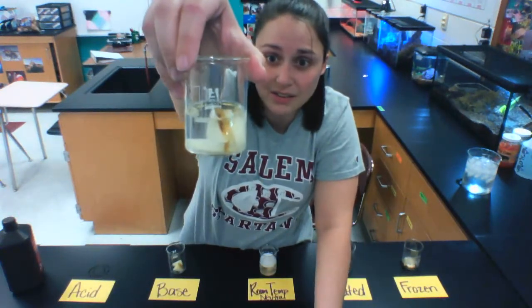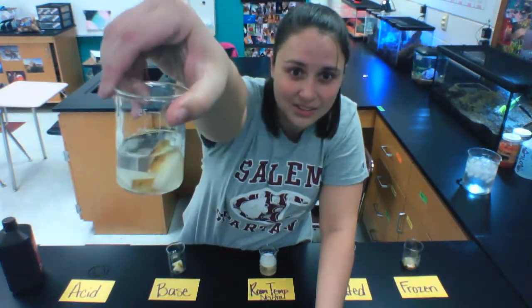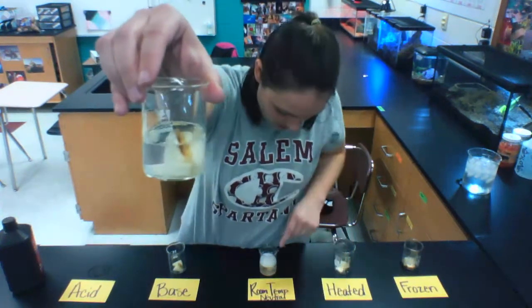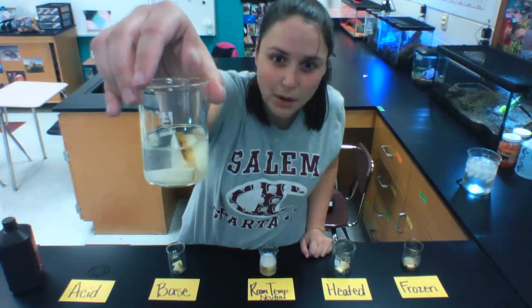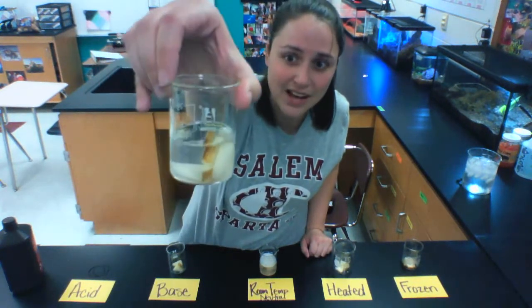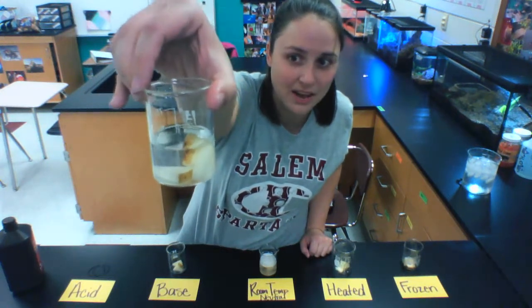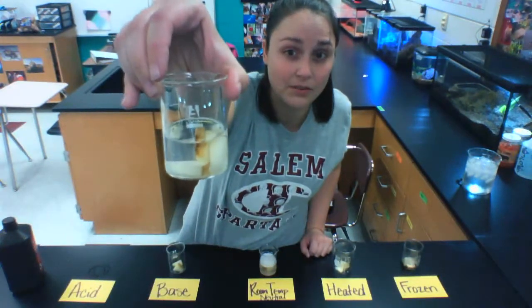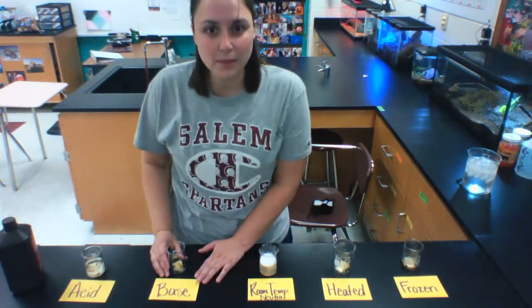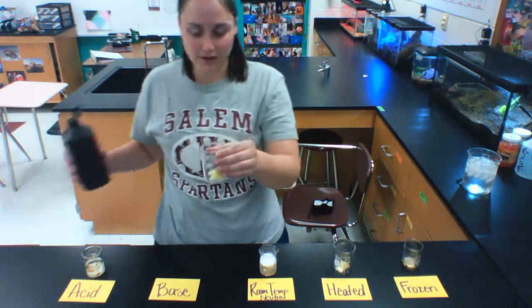I'm not really seeing very much reaction at all, just a little tiny bit of bubbles coming from the potatoes, but it's nothing like our room temperature. You can even see from here, our room temperature has bubbles on top because of all that peroxidase breaking down hydrogen peroxide, but that is just not taking place here in our acid-soaked potatoes at a fast rate. It's happening at a very, very slow rate. All right, let's see what happens with the base. These were soaked in Windex, which is a base, as we learned in our Properties of Water lab.